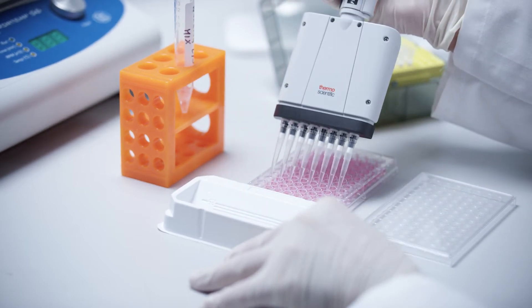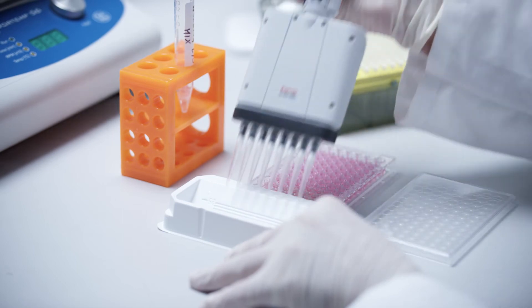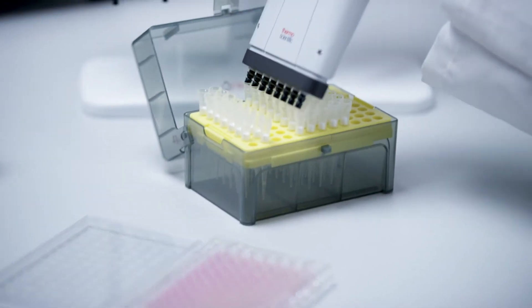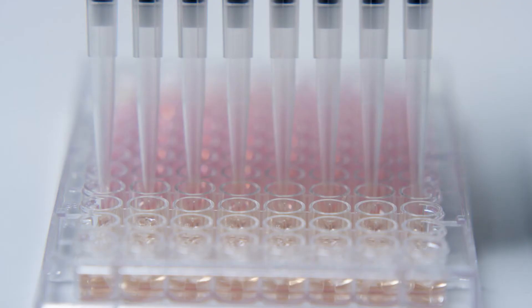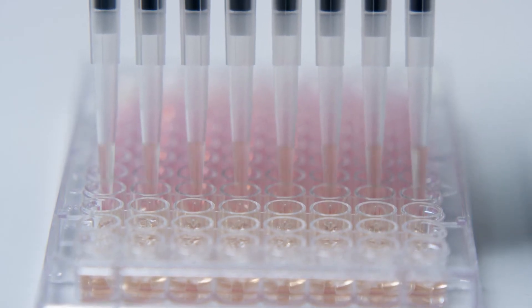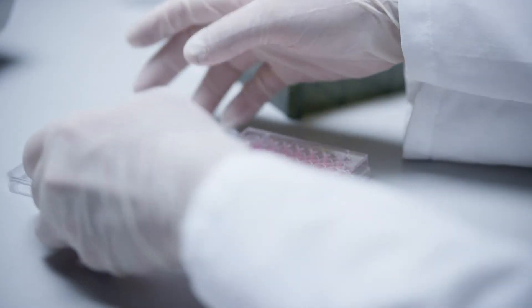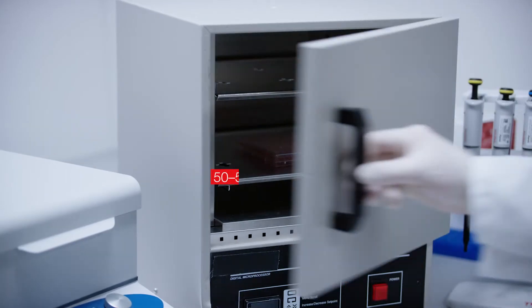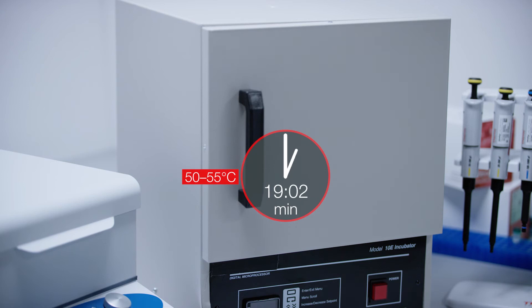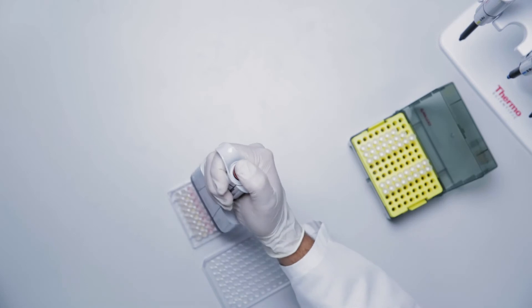As a reminder, the final concentration of common transformed cell lines is 400 cells per microliter of lysis volume. Thoroughly resuspend the contents of each well by pipetting up and down 10 to 15 times. Avoid introducing bubbles and change tips. Cover the plate with a lid and incubate at 50 to 55 degrees Celsius for 30 minutes to lyse the cells.